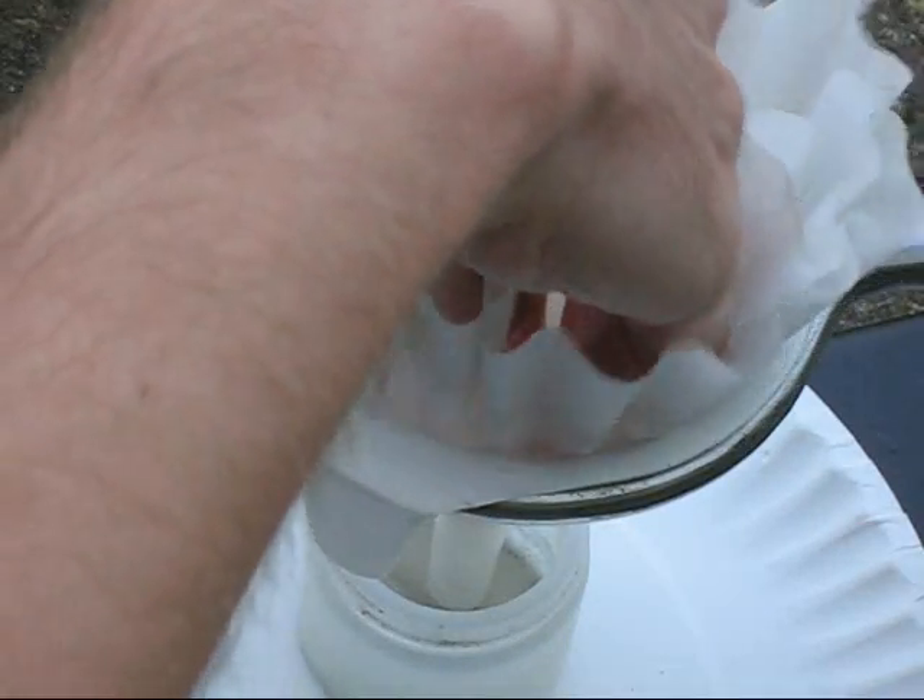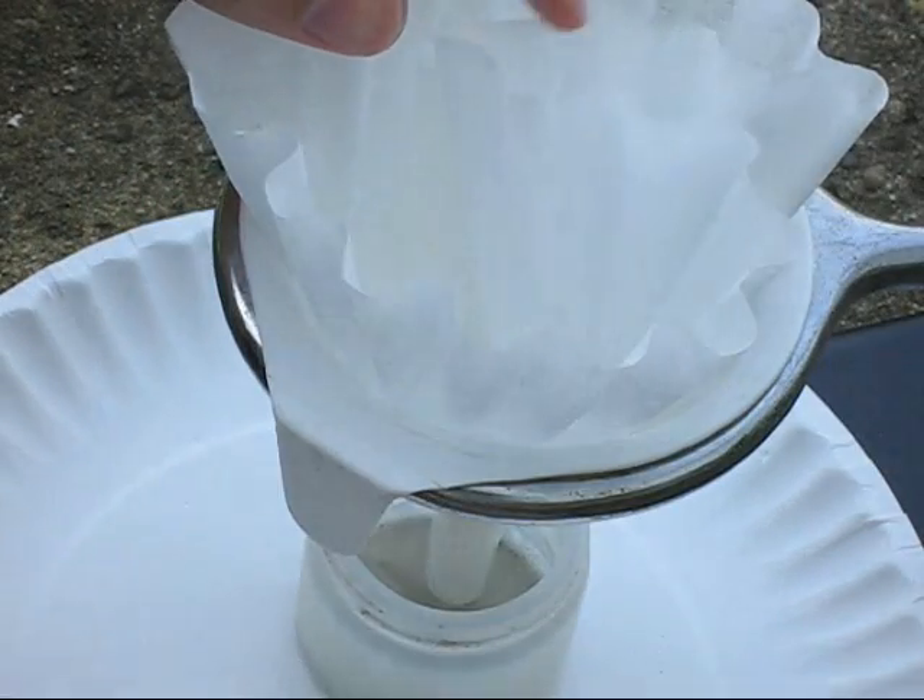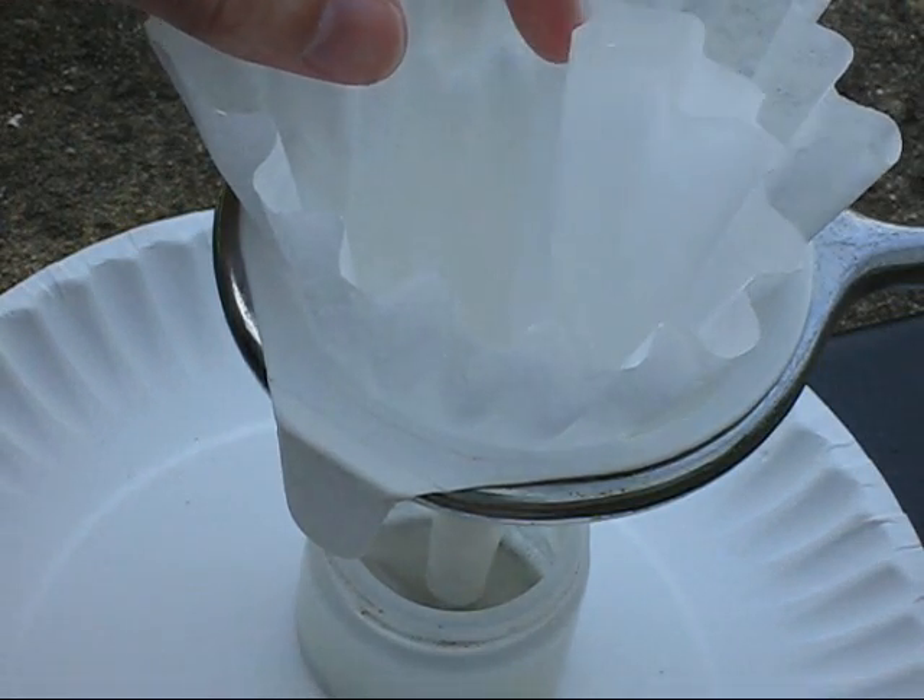This time I'm going to use a little pinhole thing I've cut into there. Hopefully this will do it, because that's actually what I kept reading about in instructions that I'm trying to follow.